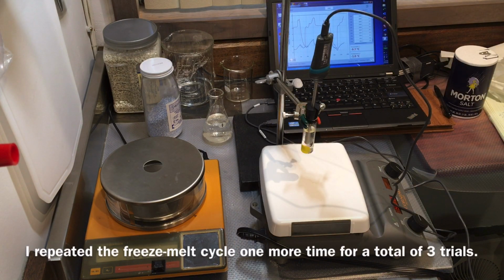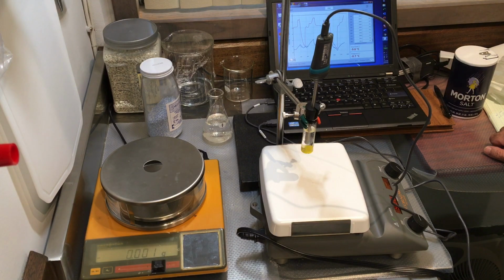So we are done with sodium chloride data. And again, I will forward you the data file for the experiment, time versus temperature, so you can graph it yourself and analyze it and pick the zone of interest for our determination. Okay, that's it. We're good for this run.